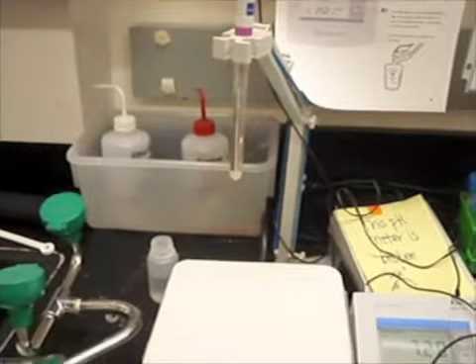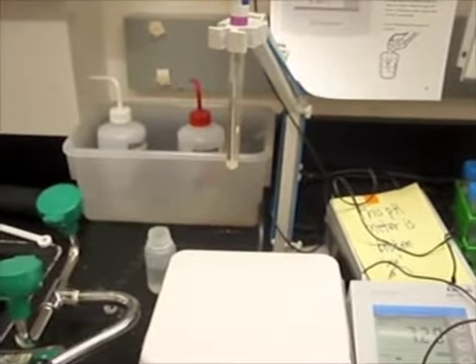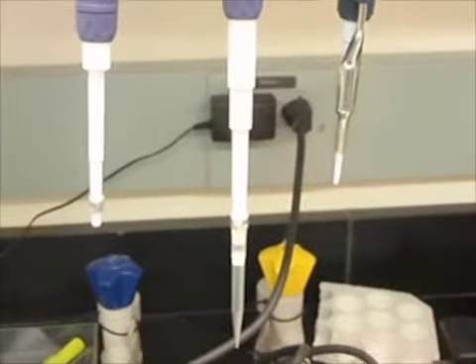pH meters are particularly neglected in this space. This one's been left out of its buffer. The damage that results takes valuable research time to undo and could be permanent. And here it is again, pH meter with the tip broken off. Those instruments aren't alone in neglect, however.